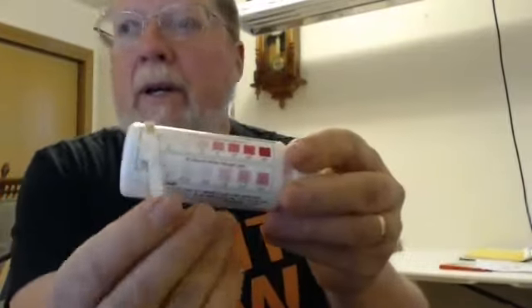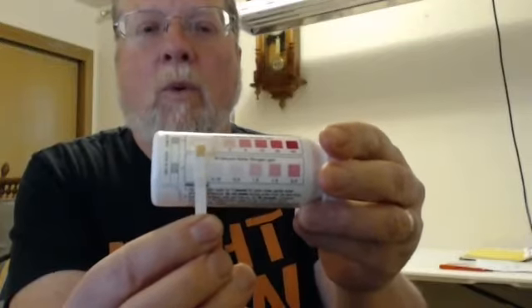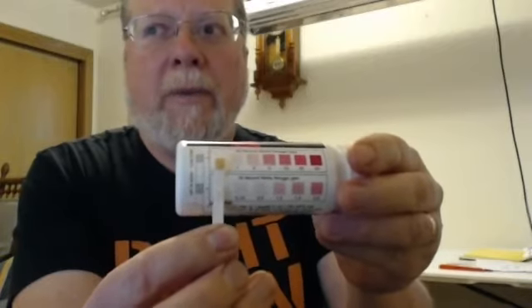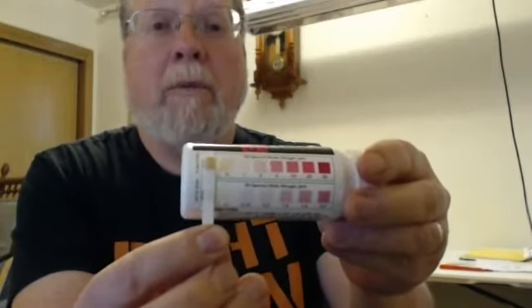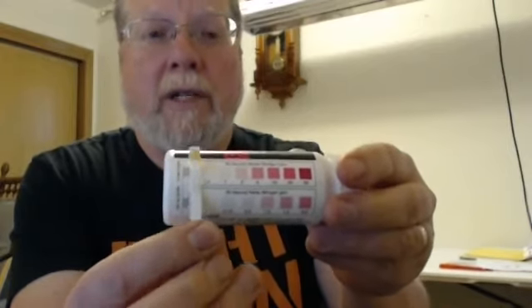We're coming up on about 30 seconds, and on the bottom, the nitrite looks about 0. We'll wait a little longer for the nitrate. We're looking for shades of pink. So this sort of tannish background is a 0 till we start to see shades of pink. Anything above a 5 will be obviously pinkish to red, and that's just not happening with this particular sample. So this particular sample is also going to be 0 in nitrate.